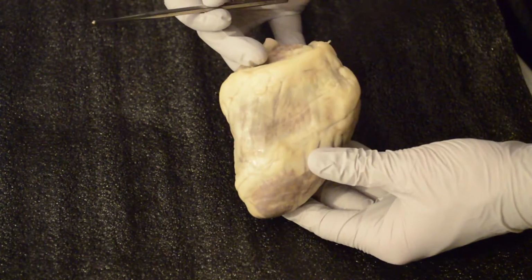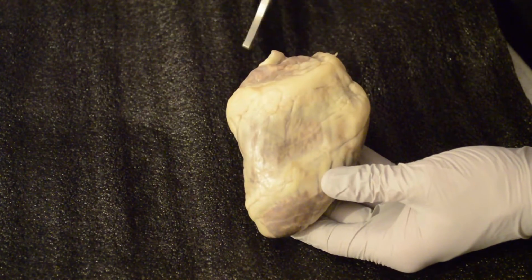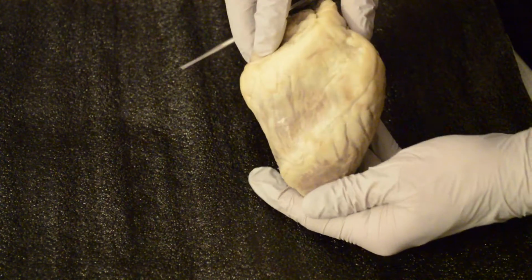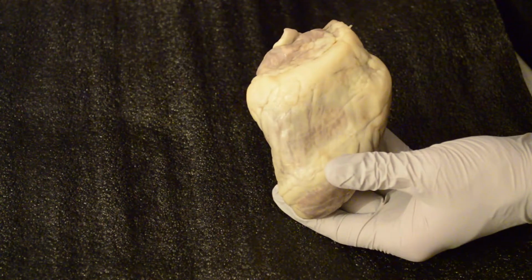We're going to be looking at the cardiovascular system and the structures and function of the actual sheep's heart. We have a great dissection today for you. We're looking at the anterior and the posterior side of the heart, at some of the external and internal structures, looking at some of the flow and some of the background.